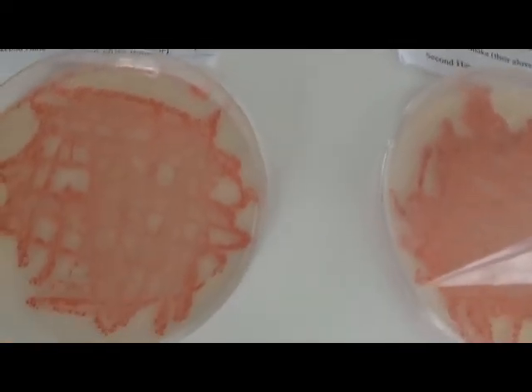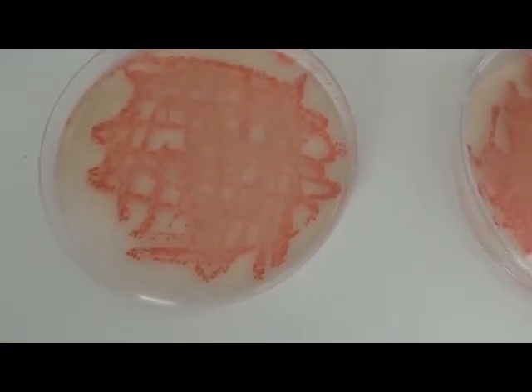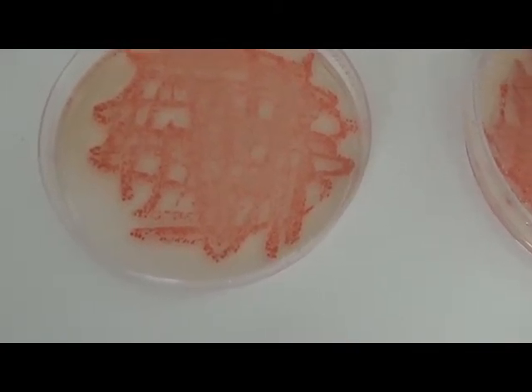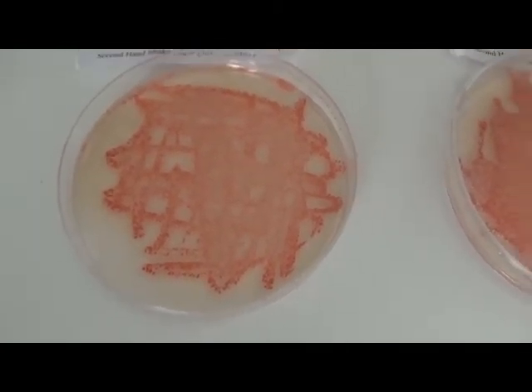Terry has it a little bit. There are some dots here, so you can see that it probably happened a little bit further along because it's not a complete lawn. It's starting to be differentiated there, where you can actually see individual dots, because it's getting a little bit less concentrated.